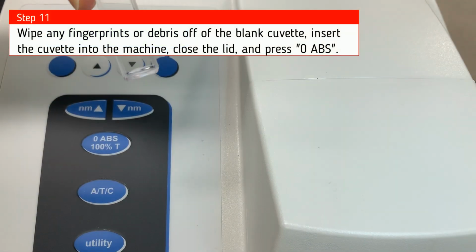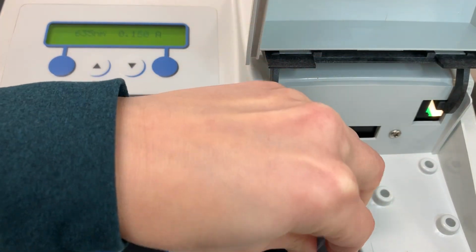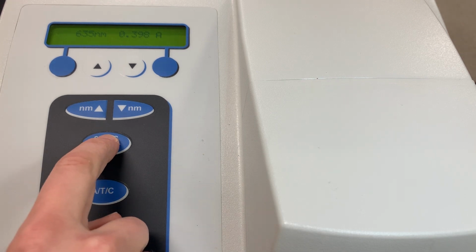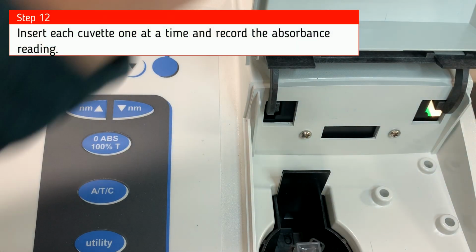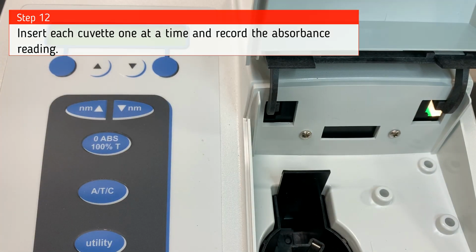So wipe any fingerprints or debris off of the blank cuvette, insert it into the machine, close the lid, and hit the 0 button. This is similar to hitting the 0 or tare button on a balance. What we're doing is we're telling the machine to disregard the absorbance of the cuvette itself and the water in the solution. Next, we're going to insert each cuvette one at a time and record the absorbance reading.